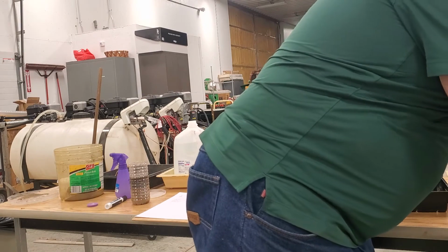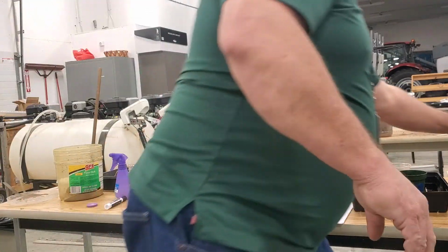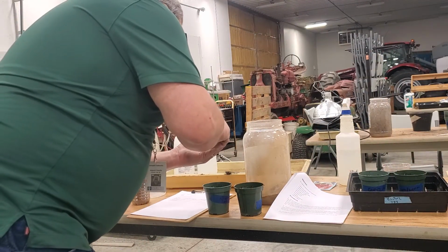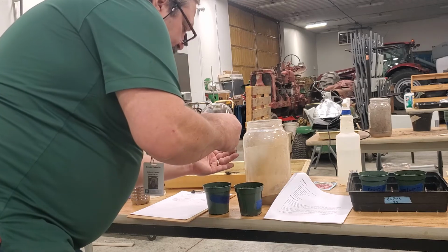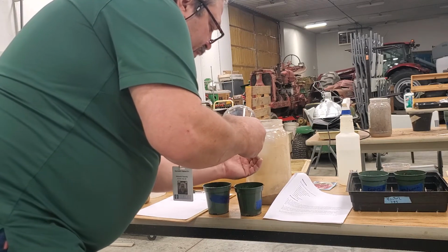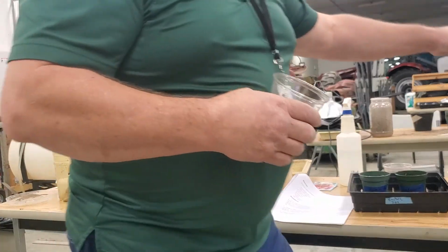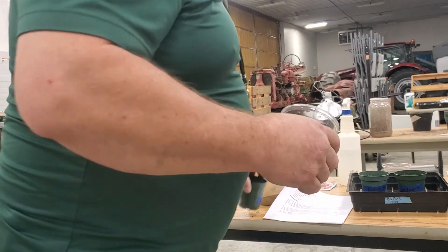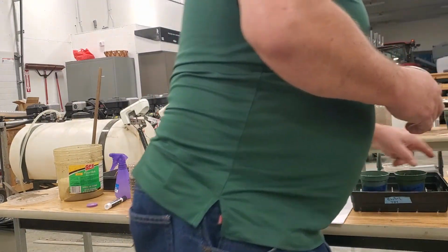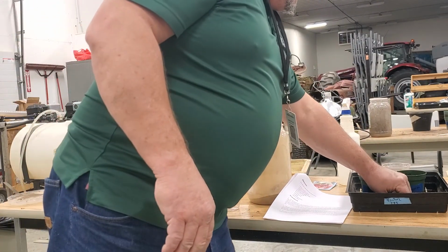The radishes are the tricky ones because they're so small. So I'm just going to estimate and say I'm going to put a few of those in there and a few of those in there. That's probably more than 10. But now I have planted each one of these. I'll push these beans down a little bit later, about an inch, half inch deep. And then we'll see what happens.